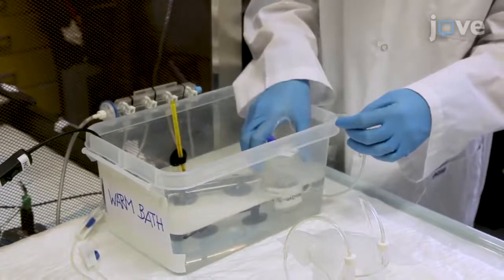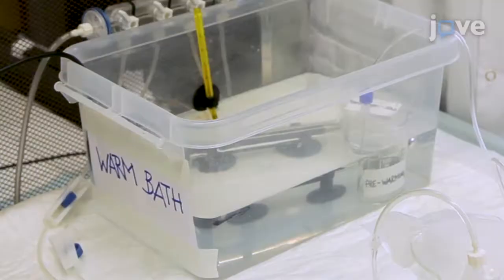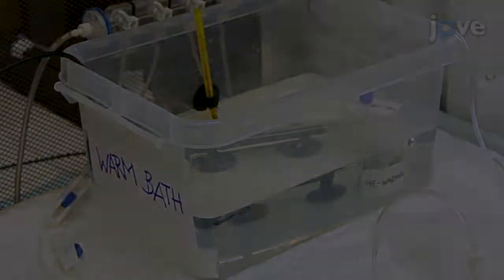Prepare horizontal hippocampus cortex brain slices according to standard procedures, and let them recover in the holding chamber at room temperature for at least 60 minutes.